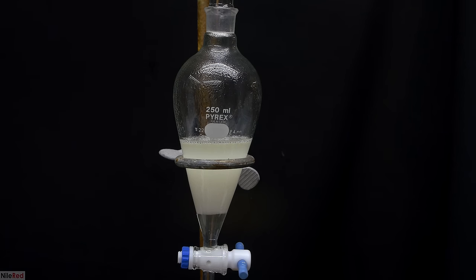Once we're done filtering, we set things up for a vacuum distillation. Unfortunately, I don't have a cow adapter that's the appropriate size, so this time I have to hot-swap things. As we heat things up, we'll start to collect our distillate, and things came over in three main fractions. The first fraction that came over was mostly just isopropanol, the second one I believe was 2-heptanol, and our desired product came over in the last one.